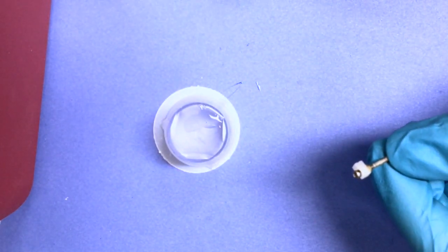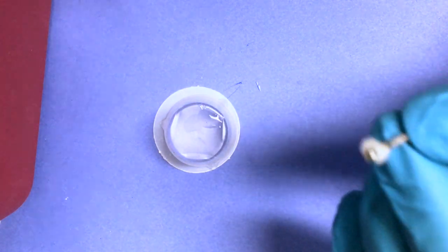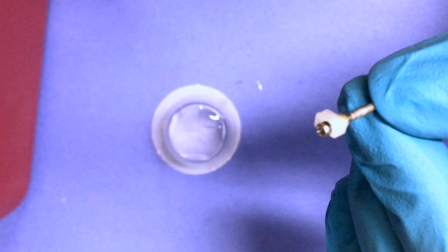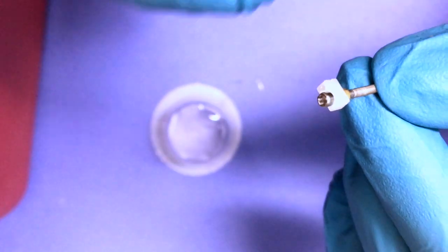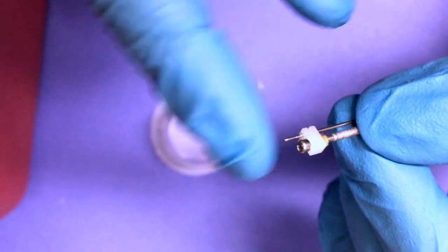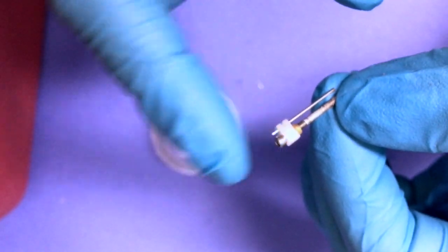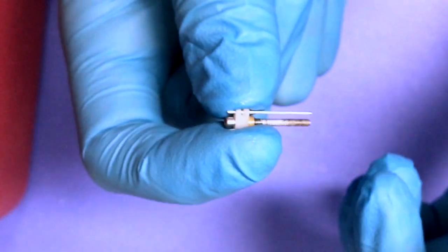The next part will be to actually insert the 23 gauge cannula into the small remaining hole of the white carrier box. When you do this, it doesn't matter how far it goes down, but you don't want the tip of the 23 gauge to be longer than the top of the hex screw.